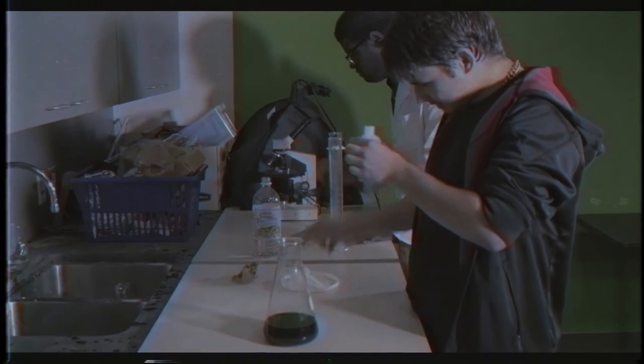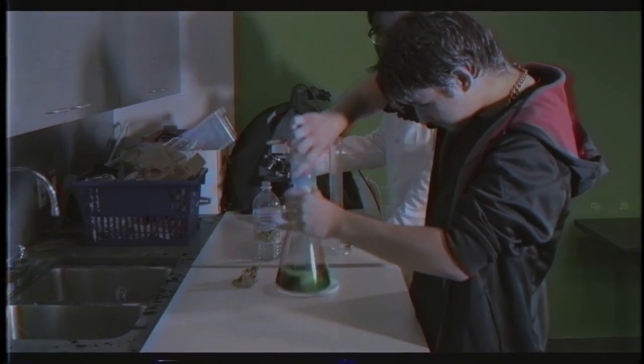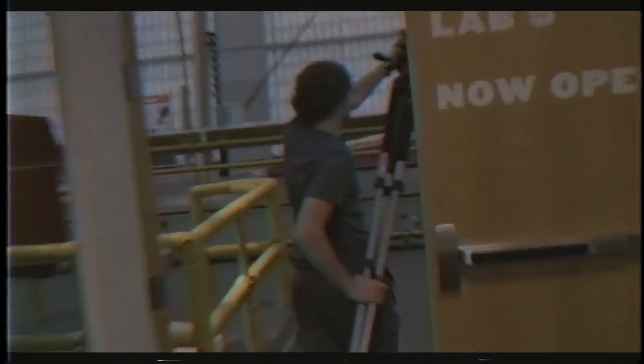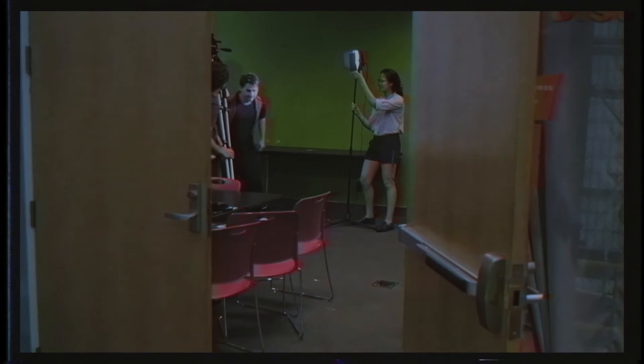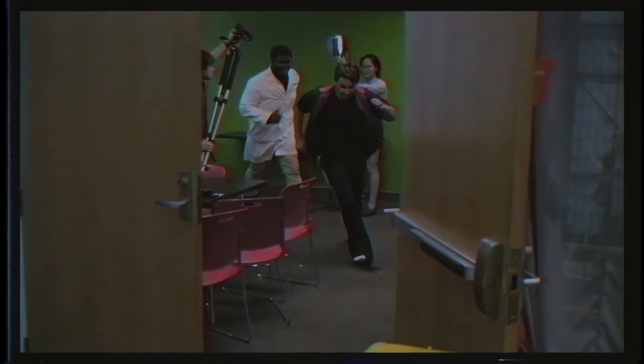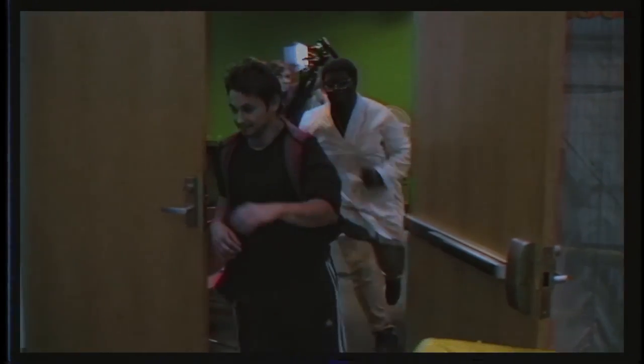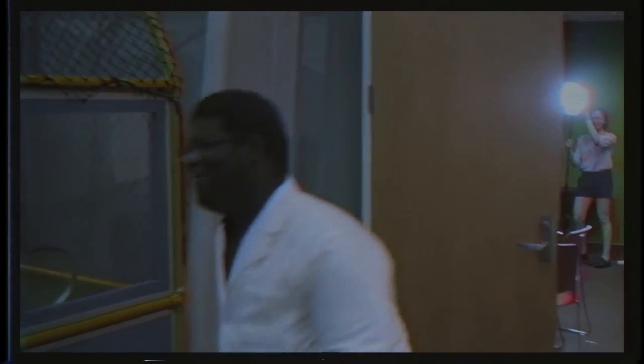So now we just mix this sulfuric acid with this water. No, Rob, no! That acid is extremely concentrated! Sulfuric acid and water need to be mixed very carefully and in specific measurable amounts. You have to add the acid to the water. Rule number 3, always know your procedure.